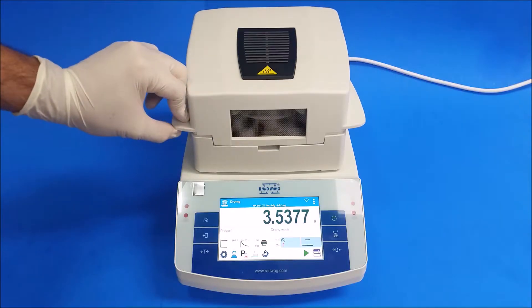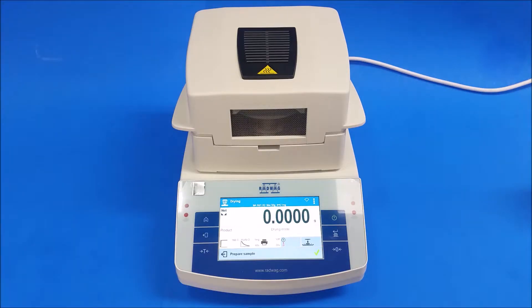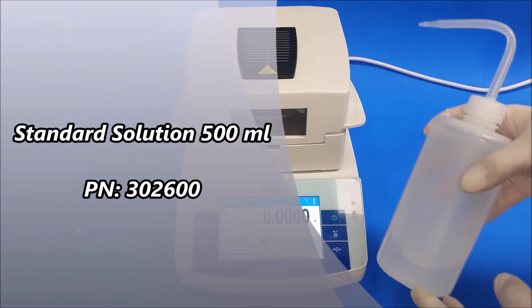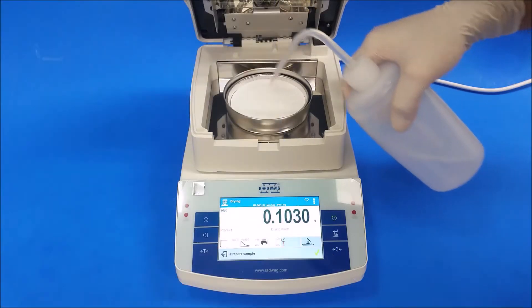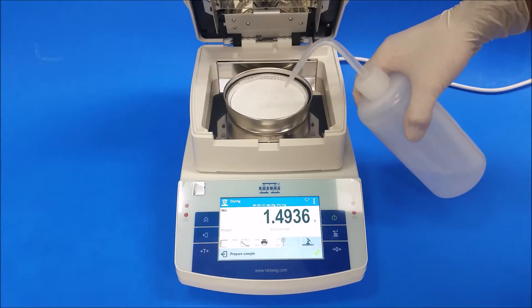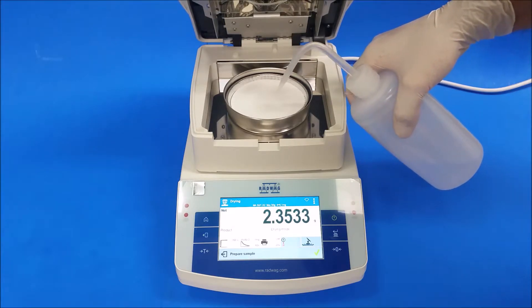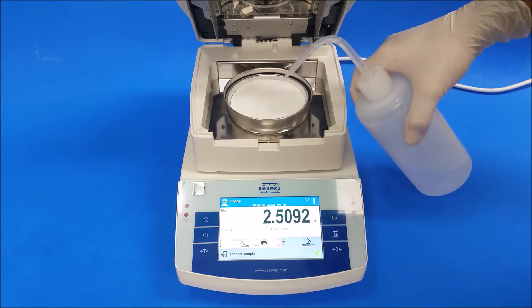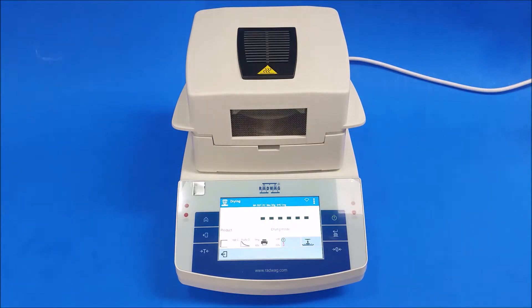Close it, then press the little green triangle, press the check mark, and now I'm going to add my sample — that's the standard solution — at about 2.5 grams. Close the hood and it's going to start the test. You can see the light blinking.